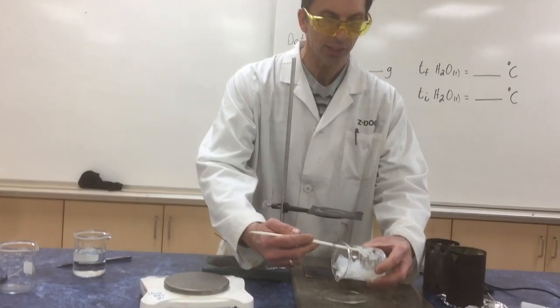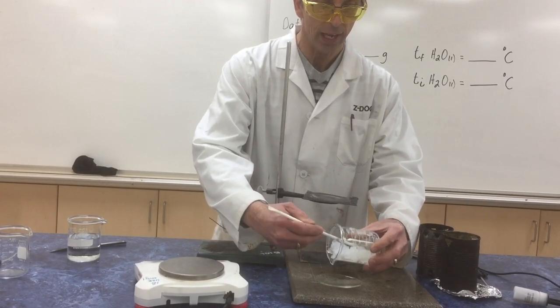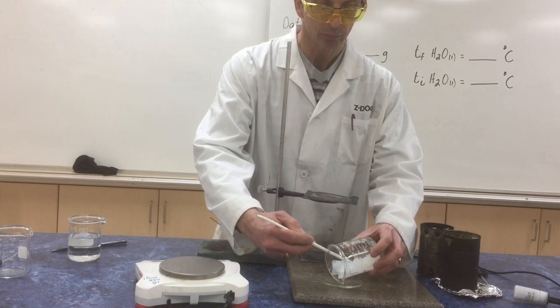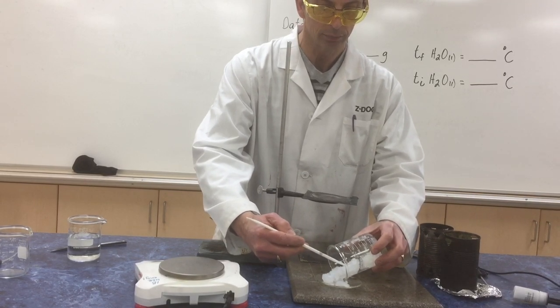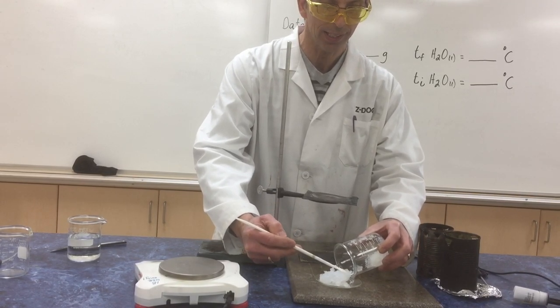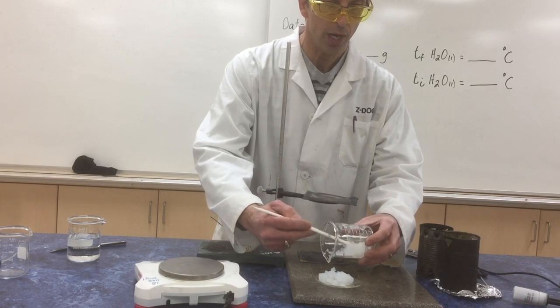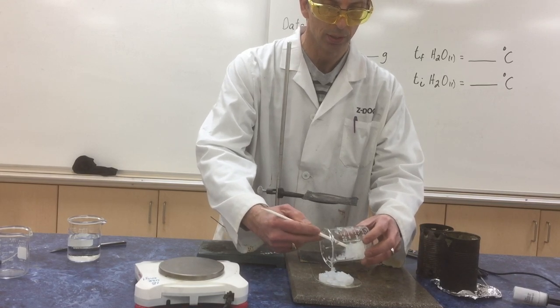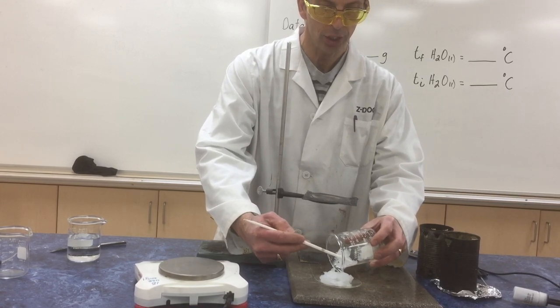I'm transferring the gelled ethanol in the calcium acetate substrate to this watch glass for combustion.